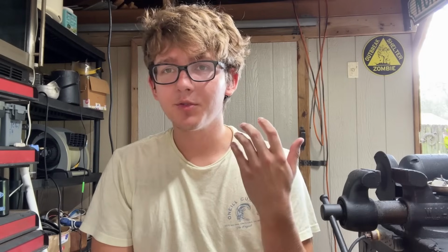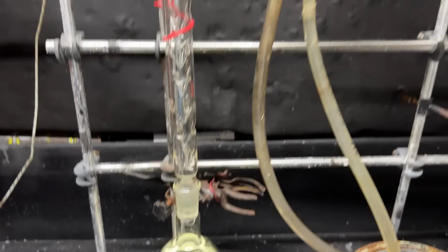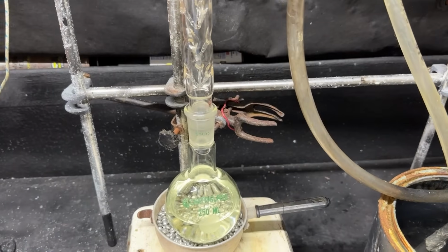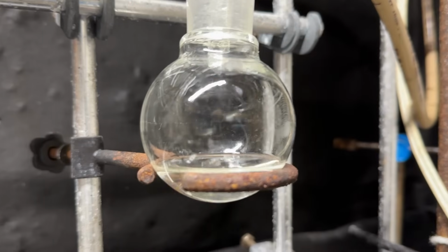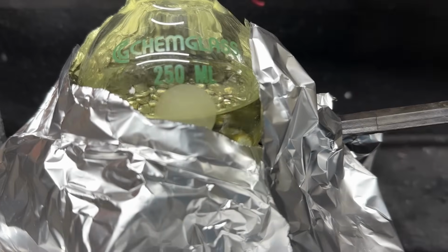So now that I got my samples, it's time to attempt to collect all of our isoamyl alcohol out of it. And well, the simplest way to do this is just to do a fractional distillation. So I went ahead and set up a whole apparatus for fractional distillation, and then I added our samples in and started the distillation. At first, we got a bunch of low boiling stuff, which is probably methanol, a little bit of acetone. There really wasn't much of it, but everything else that came over was pretty much just ethanol and some water.